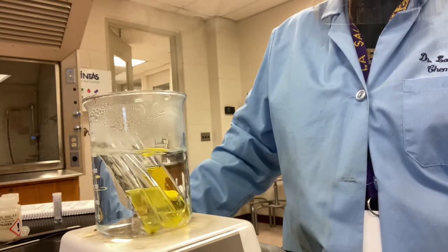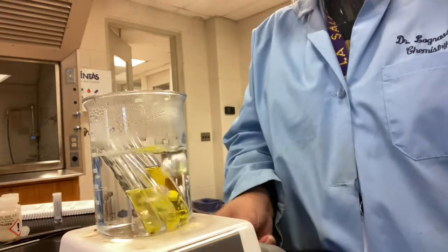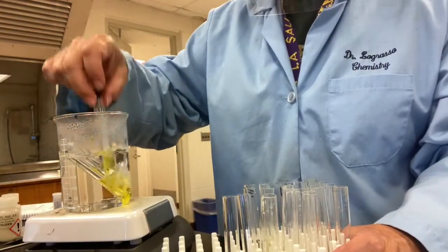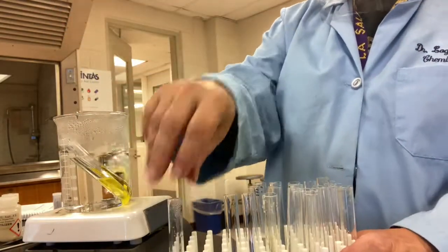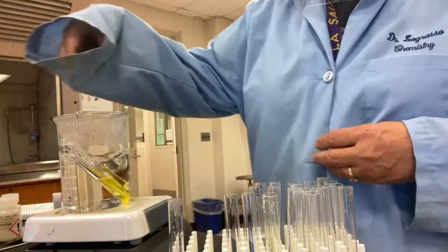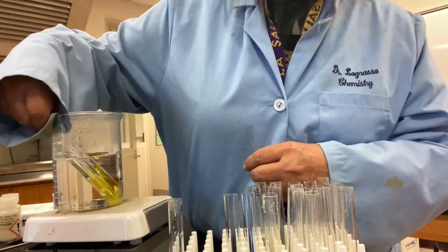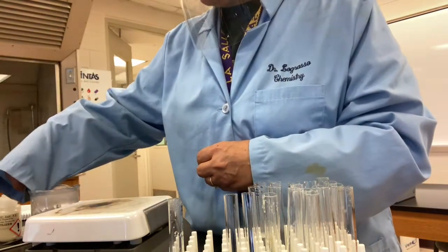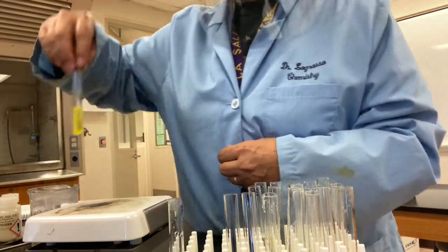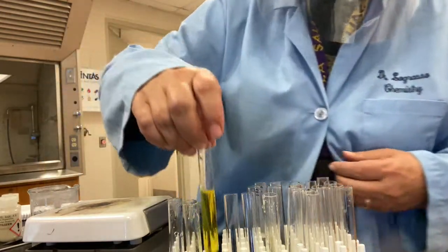I'm going to take them out of the rack and see if by cooling it, I can encourage the precipitate to form a bit. Ouch! Never mind me. Oh my gosh. I know you're probably laughing at me right now. Let me just take it down a bit. Let's see if I can get it out. Scorching my fingers. Wowzer. Do not do this at home.